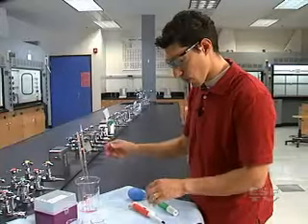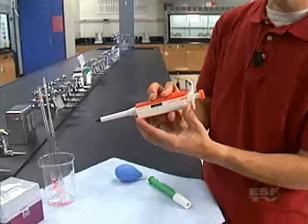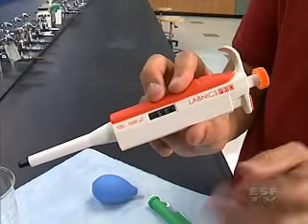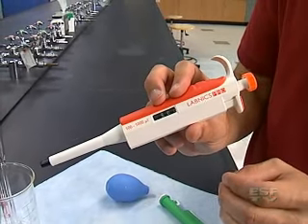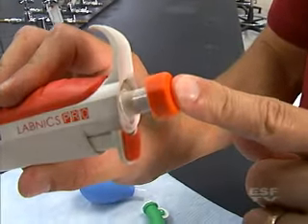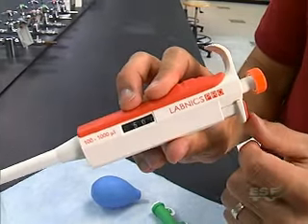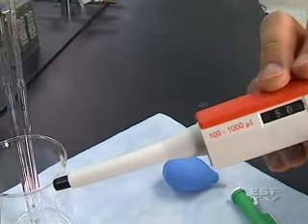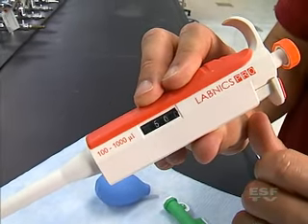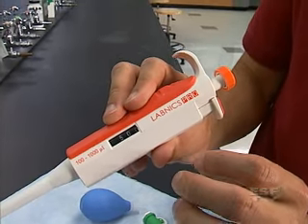The last piece of equipment we're going to use is the micro pipette. You may have seen it before in our segment on volumes or on TV, and it's used for very accurate measurement of solutions. It has a few parts to it. First is the plunger, used for withdrawing and dispensing solutions. We have a release for releasing the tip. We have the numbers — in this case 500, which is in microliters — so we can use 500 microliters with this pipette.